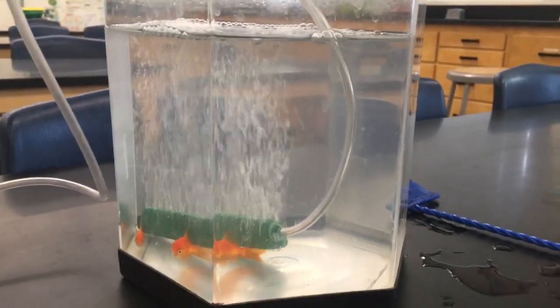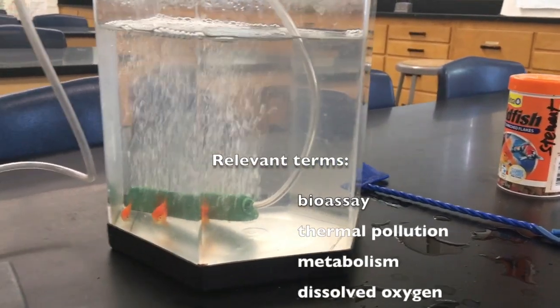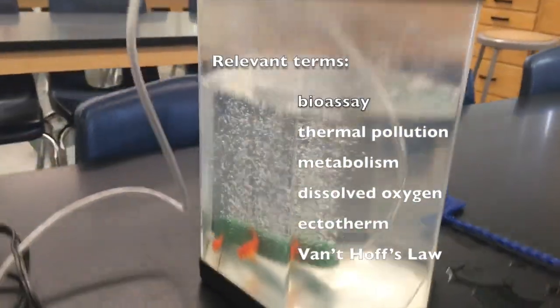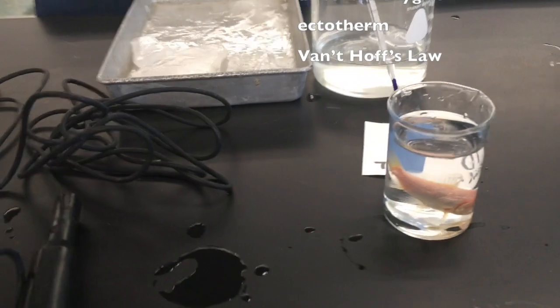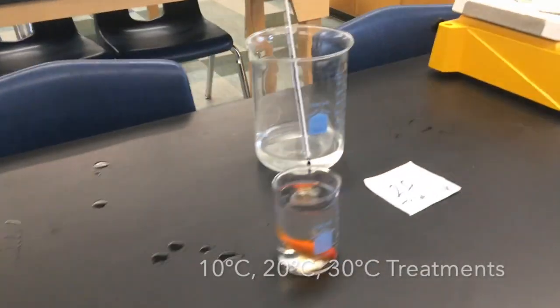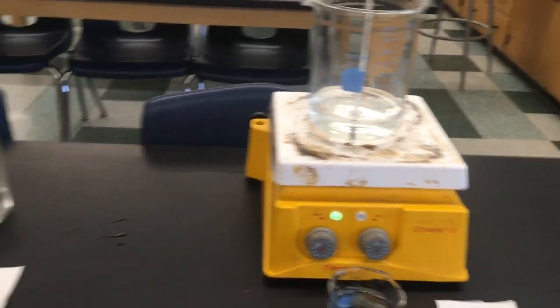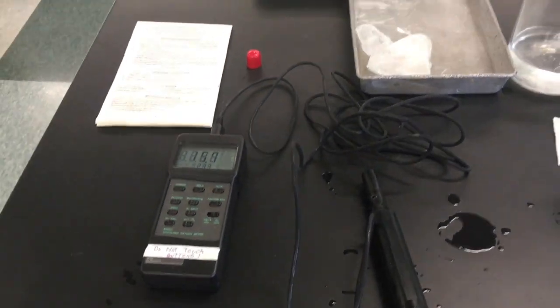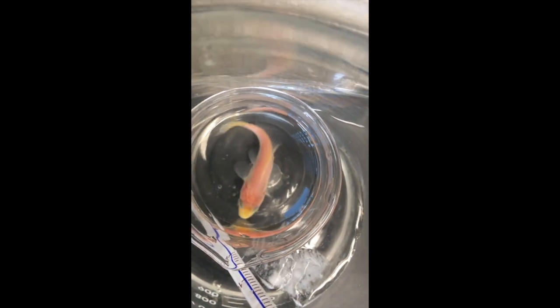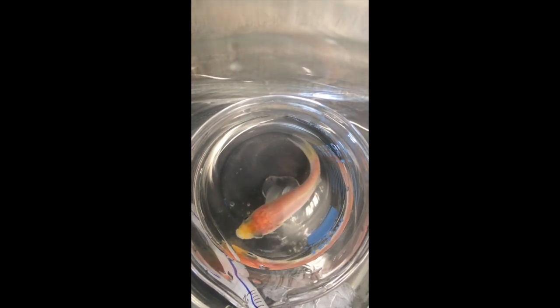We are going to complete a bioassay to assess the impact of temperature — thermal pollution — on fish respiration, and use that to test stress. We've moved a fish each into a treatment that will be at 10 degrees Celsius, 20 degrees Celsius, and 30 degrees Celsius. We will be using an oxygen meter to measure levels of oxygen in each treatment, and we will also be measuring the opercular rate of the fish to ascertain their respiratory rate and get a sense of the level of stress caused by any changes in temperature.